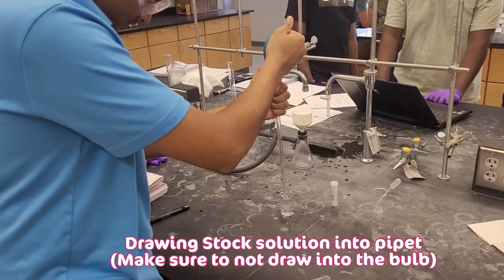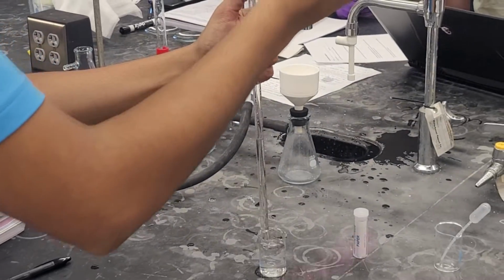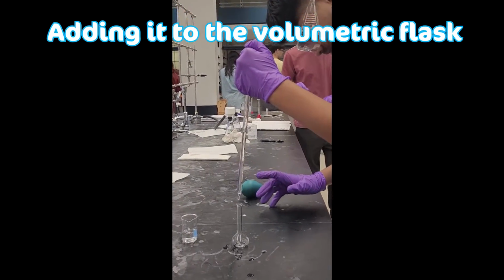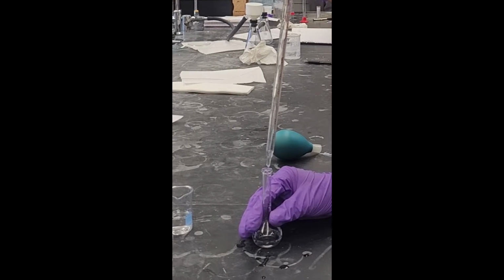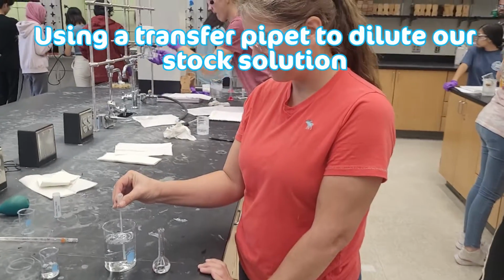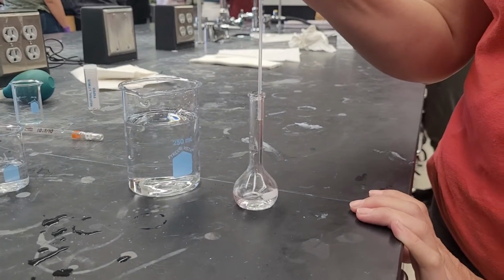Here we are drawing our stock solution into the pipette to transfer it to a volumetric flask. And here we are using a transfer pipette to add water to the 25 milliliter graduation.